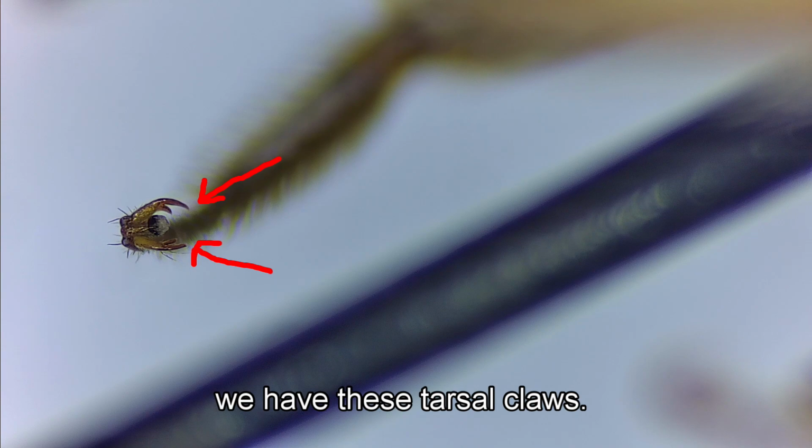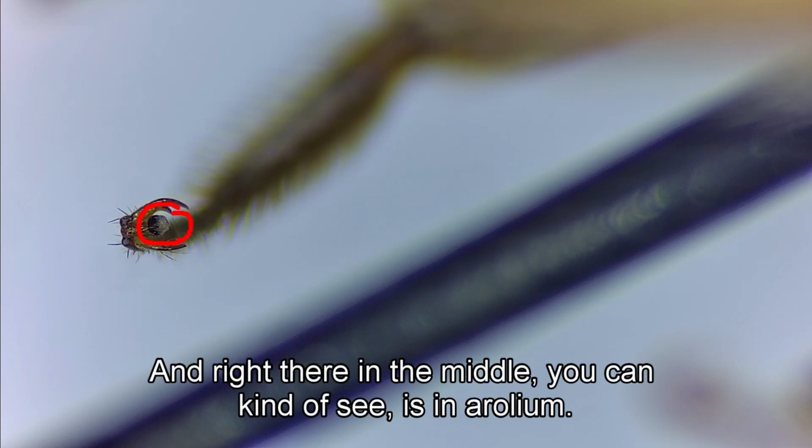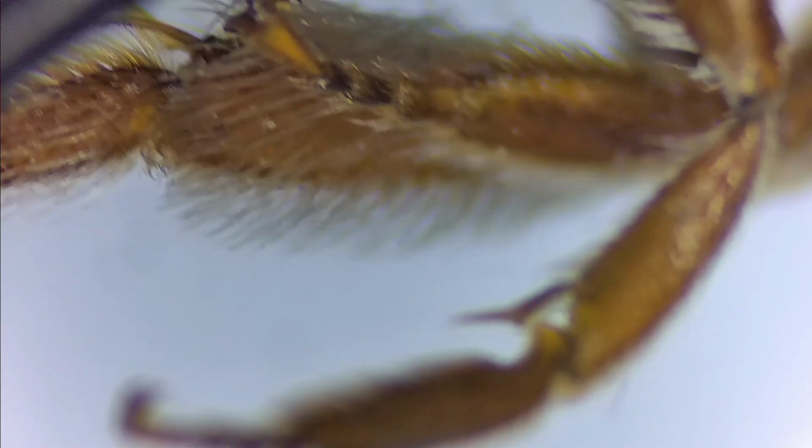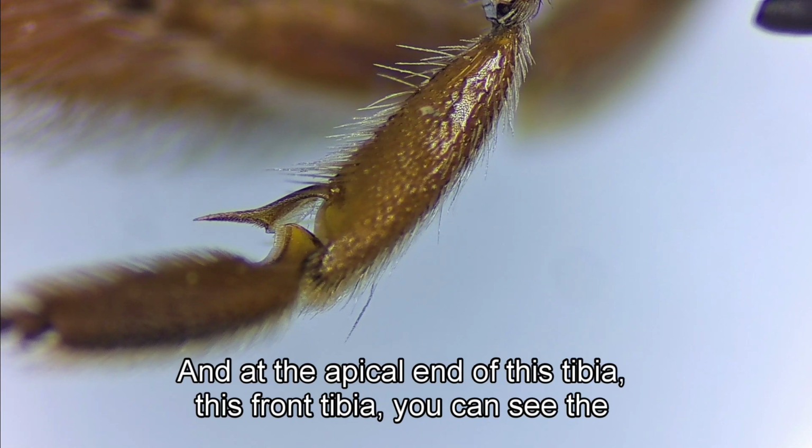we have these tarsal claws, and right there in the middle, you can kind of see is an arolium. And all of these things can be really helpful to look at with certain bee genera. And then, so I just want to back up for a second here. And at the apical end of this front tibia, you can see the tibial spur.